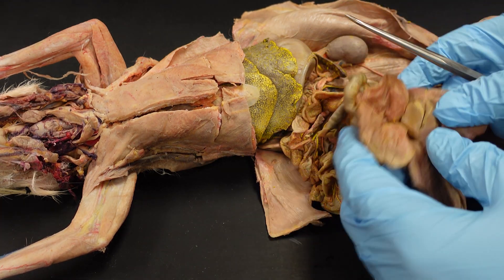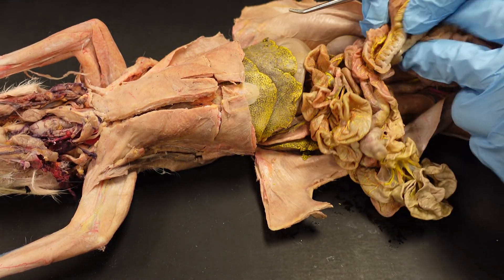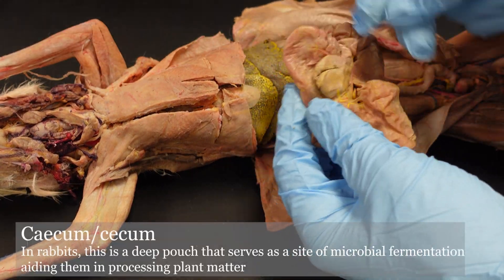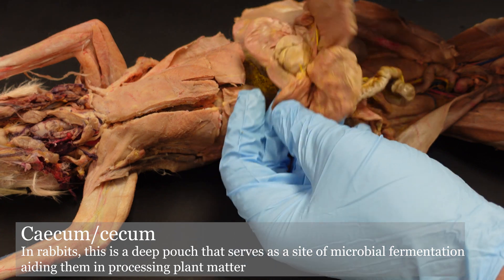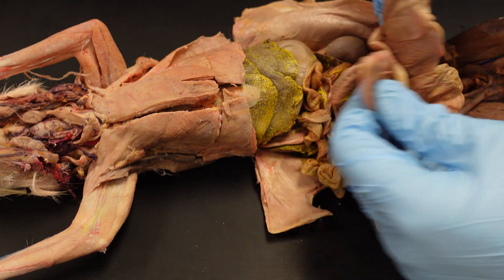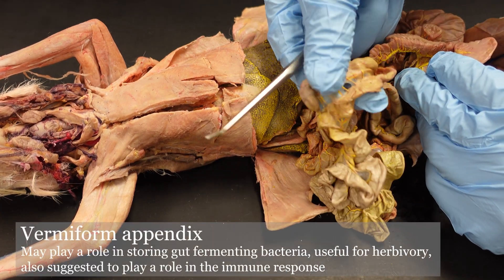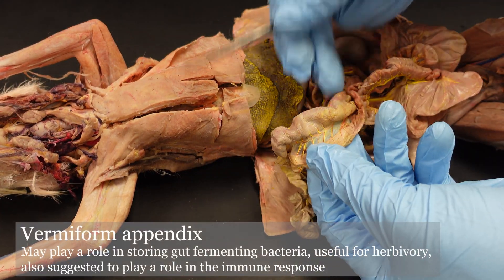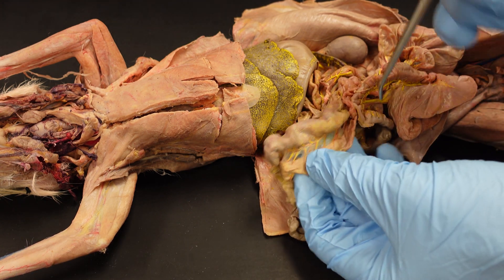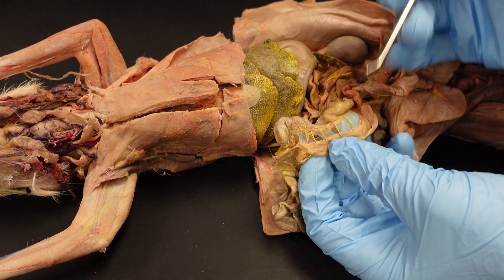Where the small intestine meets the large intestine, we have a cecum. The cecum in the rabbit is this big baggy offshoot right here, and at the end of that cecum is the vermiform appendix. One thing you can do with your rabbit is take all of this apart so you can see everything laid out really clearly — we'll do that in another video.